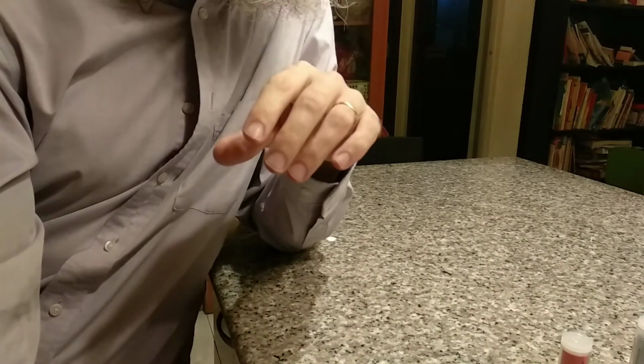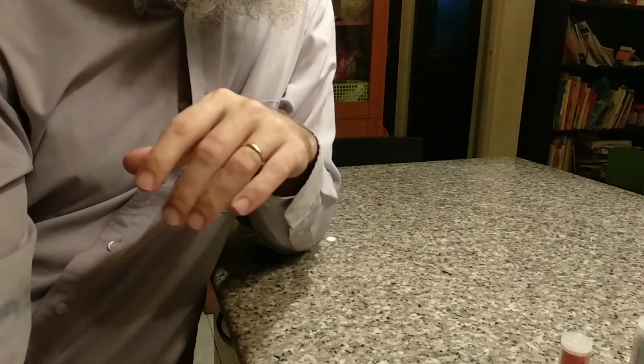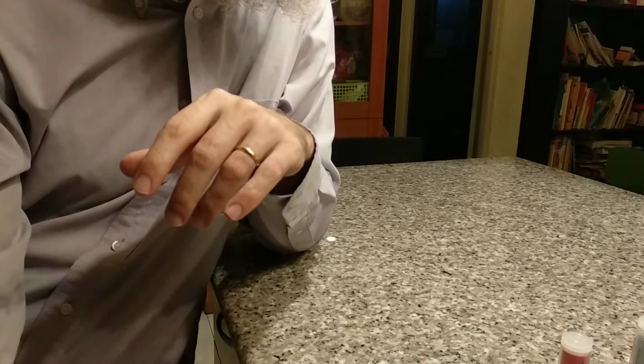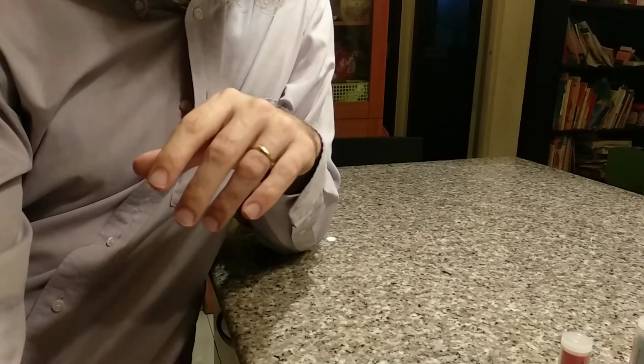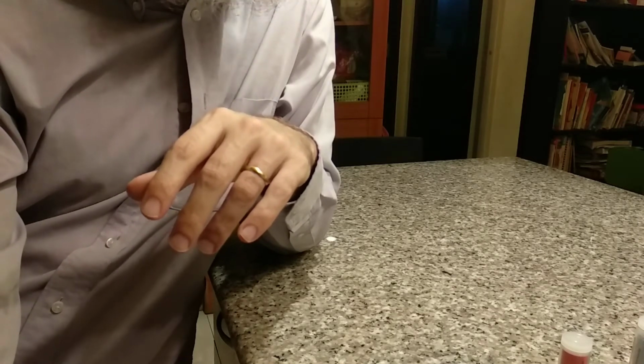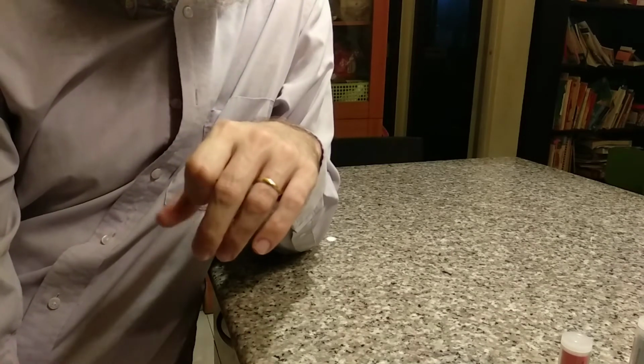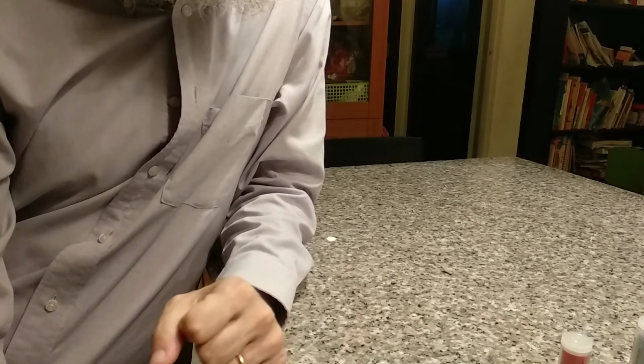So our acids, we have some acids that are strong acids and some acids that are weak acids. What's the difference between those strong acids and the weak acids? Okay, you might remember when we were talking about lab safety and I talked about hydrochloric acid, I said it's a strong acid. And even though we were working with dilute hydrochloric acid, we said, okay, dilute means you've got some time before it starts doing significant damage to your skin.